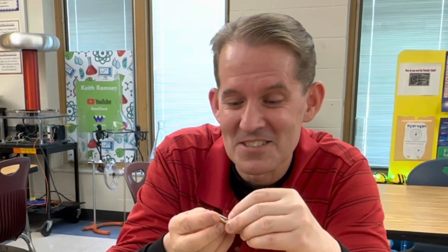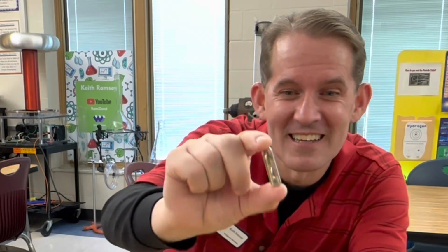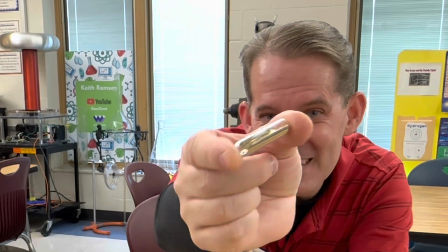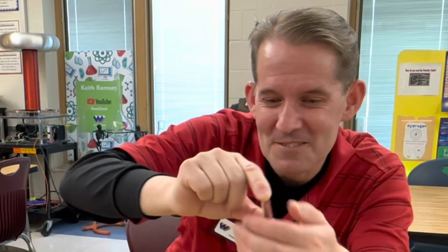One of the things that I think is so special about cesium is that it can be a liquid at room temperature, just like mercury or gallium. And so if I just warm it up in my hand, it'll start to move through this glass ampule as a liquid. And I want to show you what that looks like. So it's starting to melt now. You might be able to see it move through the ampule. Let me warm it up a little bit more in my hands.